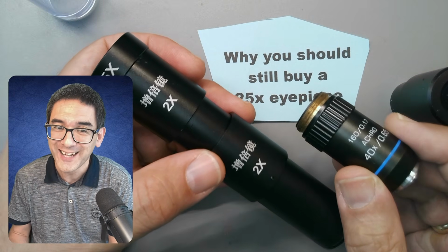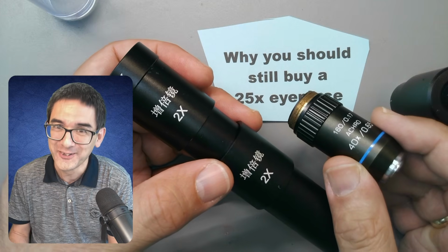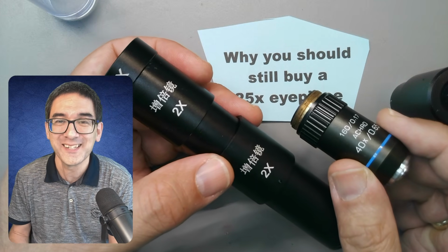But if you're still interested, I actually did try out this combination. Here is a new video, and that's where I tested this as well.